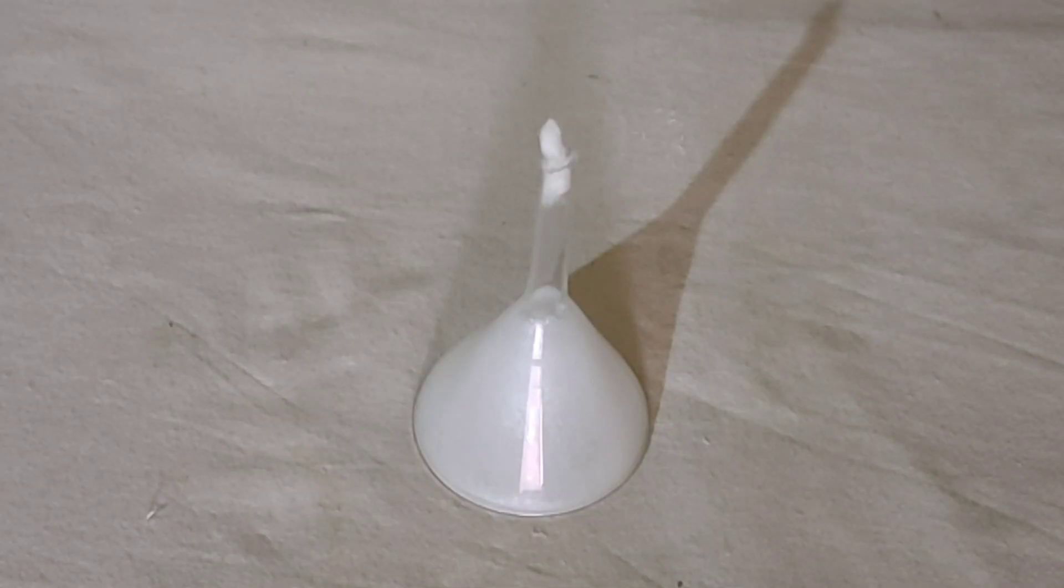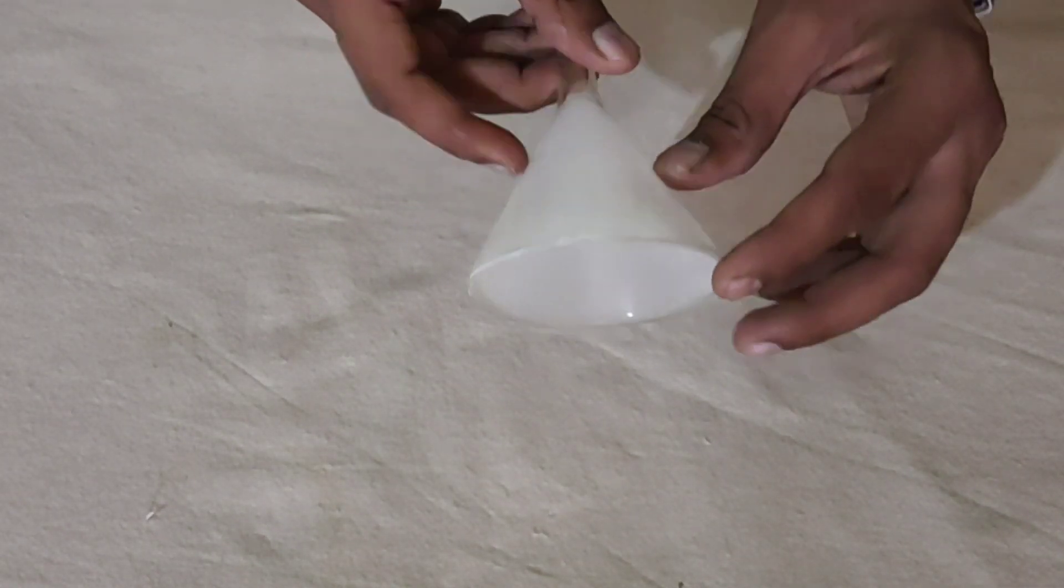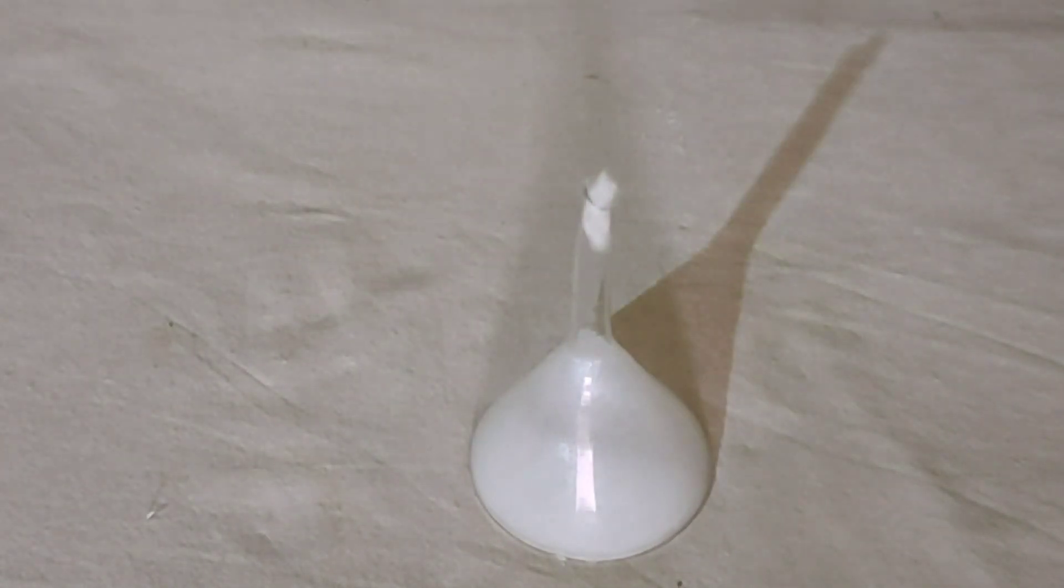So, what have you learnt from this experiment? On the inner wall of funnel, solid deposit was observed. Solid camphor on heating changed from solid state directly to vapor state. This process is known as sublimation.